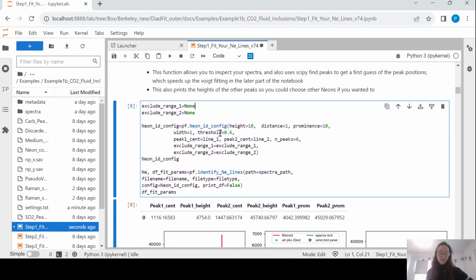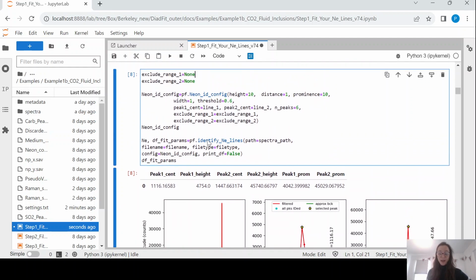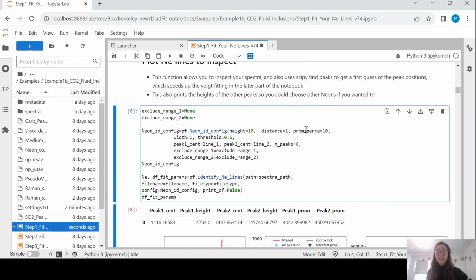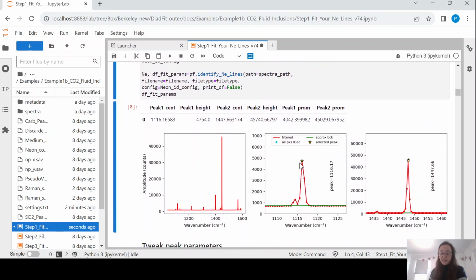Now, what this function does is it basically allows you to look at your spectra, and more importantly, it is using SciPy to try and find the prominent peaks in your spectra. So the SciPy find peaks function has these parameters: height, distance, prominence, width, and threshold. The most important ones to tweak are basically the prominence and the height. So what you want to do is run this and check that it has found the peaks in the region you're interested in.